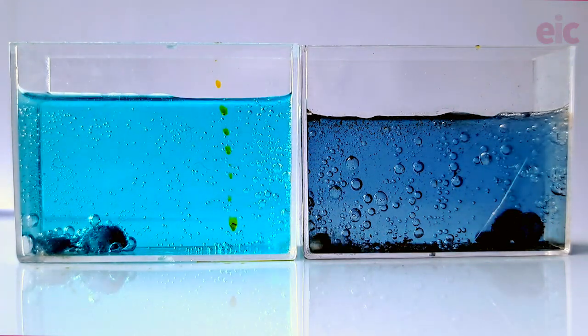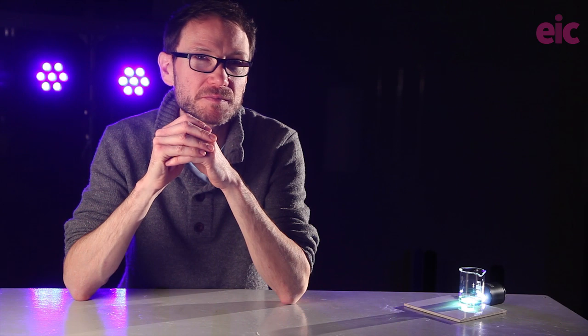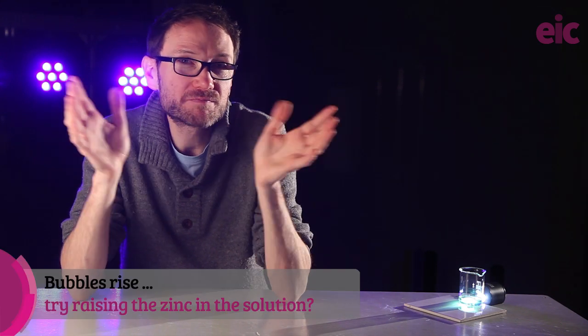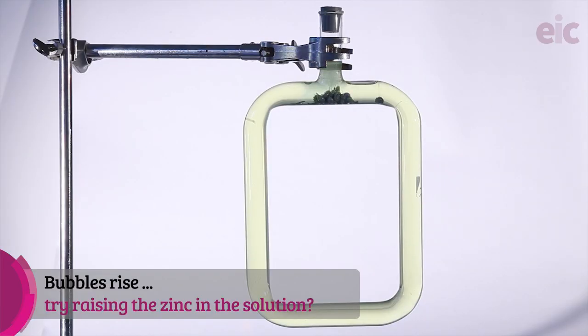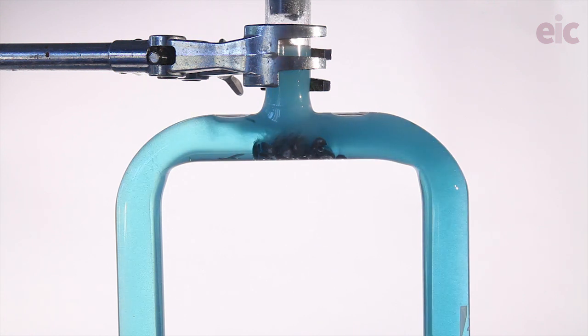This might not bother you so much, but these vanadium colours are beautiful and we want to be able to enjoy them. There's a real subtlety to the vanadium 2,3 mixture which gets totally lost in a cloudy solution. Of course, bubbles tend to rise, so I wondered if the loop of glass tubing that many schools will have on hand for demonstrating convection might come in handy here. I could create an elevated platform for the zinc, and the vanadate solution could just kind of move past it.